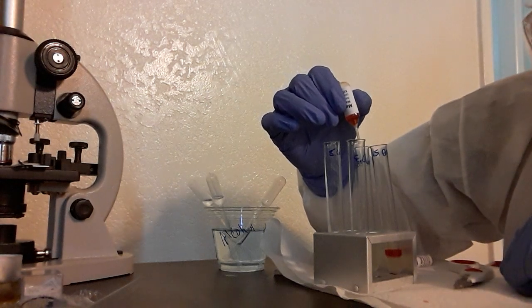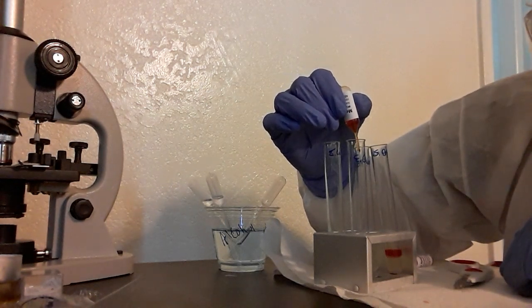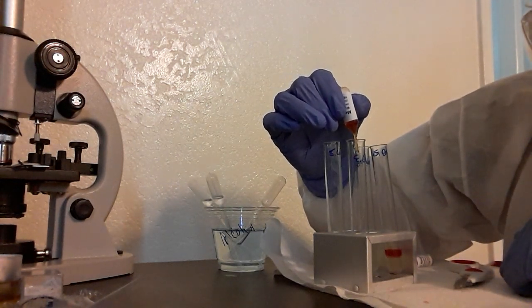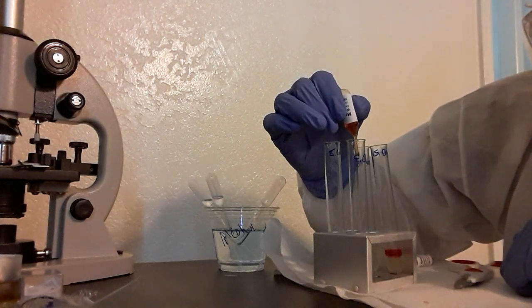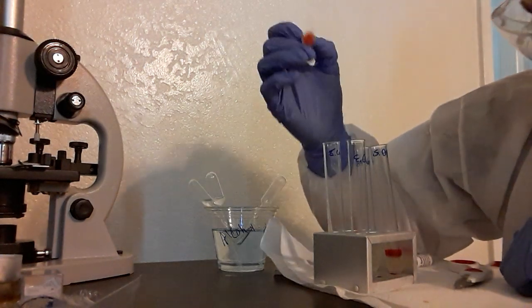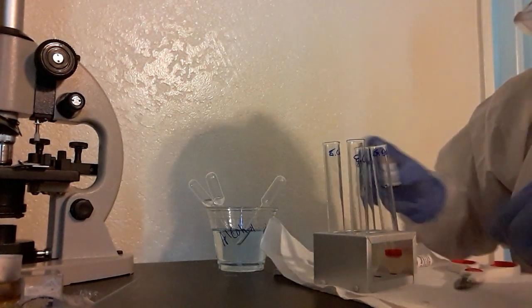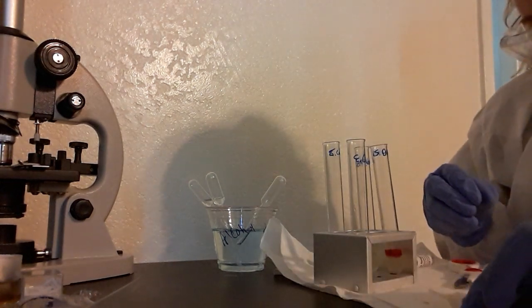Let's see how the E. coli goes. One, two, three, four, five, six, seven. Alright, we're going to set that very carefully over here so we don't mess up the table.